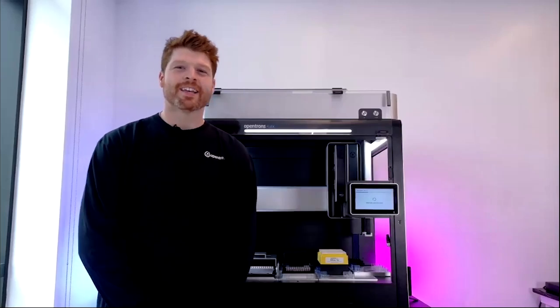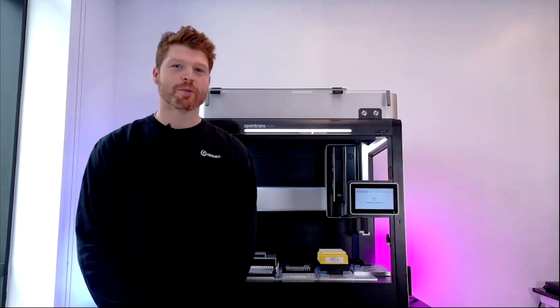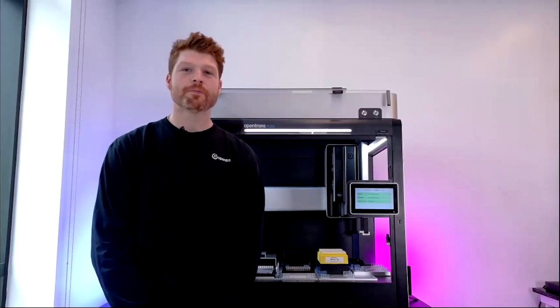Hi, everybody. Hope everyone's day is going well. I'm just resetting the robot here as we get prepped for the demo.